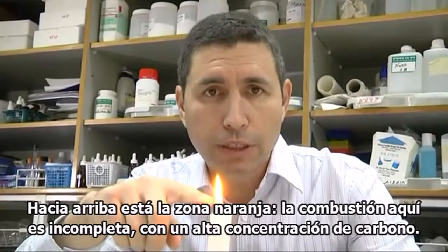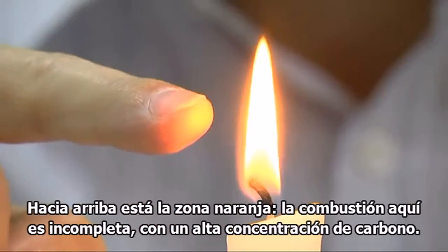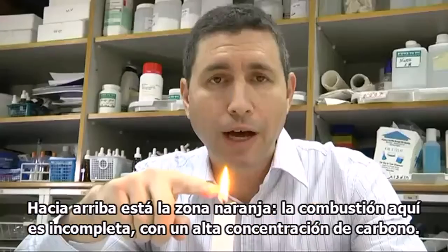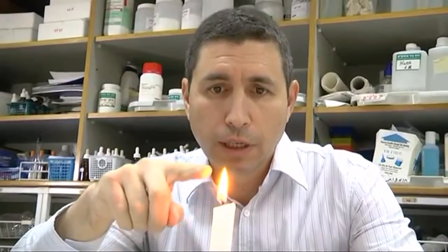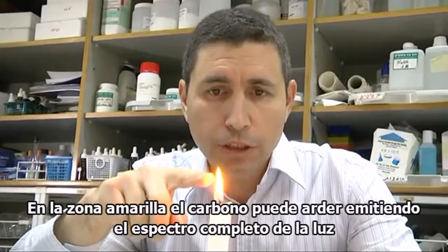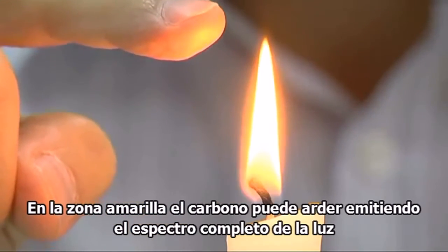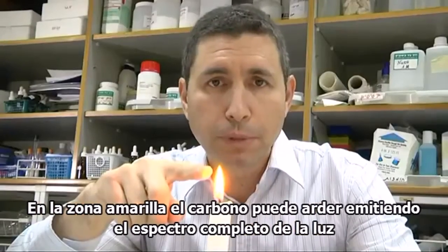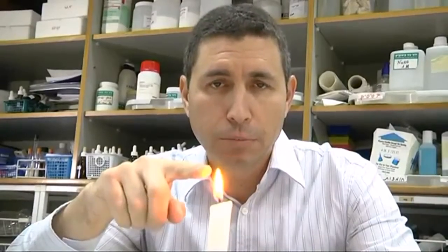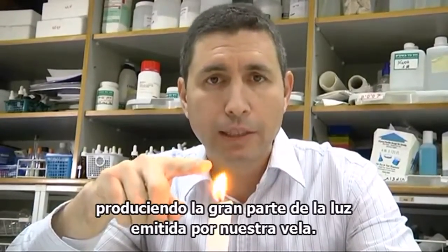Next up is the orange section, where combustion is incomplete. Instead, we have a high concentration of carbon. The yellow section is where the carbon particles ignite to emit the full spectrum of light, producing most of the light coming from our candle.